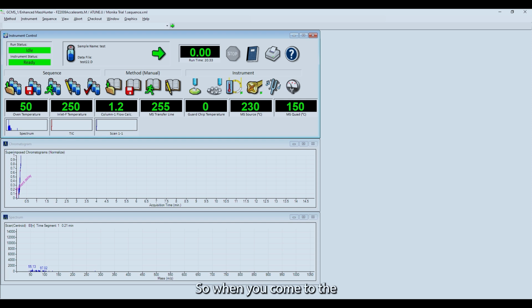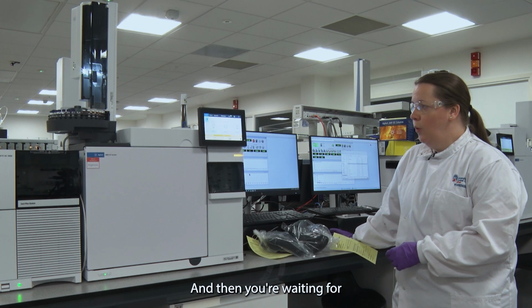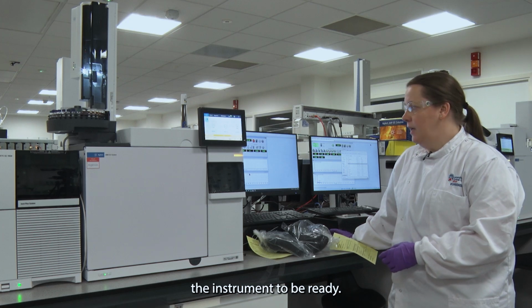So when you come to the computer, it should be on this screen. To start your run, you go to the green arrow and check that the path is your module and accelerants. And then you're going to put a file name in. I'm going to be analysing the glove, so I called my file name glove. You then press OK and run method, and then you're waiting for the instrument to be ready.